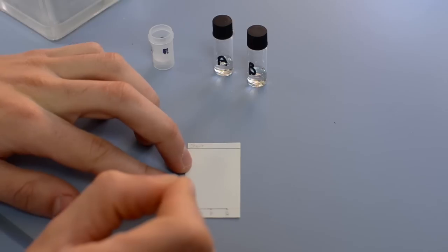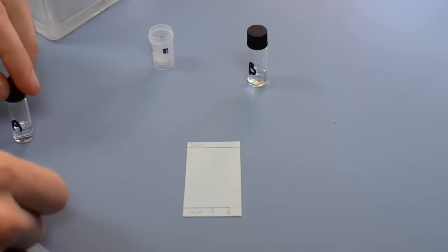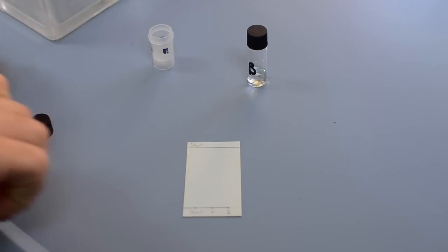Along the progress of the reaction, take samples from the reaction mixture at set intervals, for example every hour, and develop the TLC against the starting materials and or the previous sample.